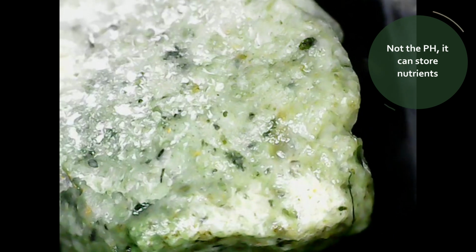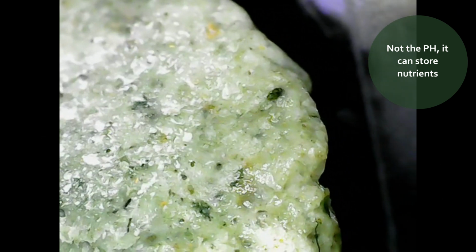And now looking at it in a wet version, you can see that the green is a lot more evident. There's less of that white. You can see that saturation of water around the rocky material, but you can also see those other inclusions. And another material from semi-hydro mixes, let's have a look at lava rock.